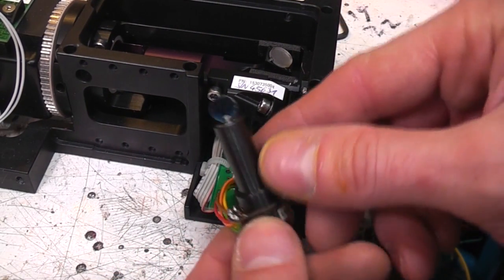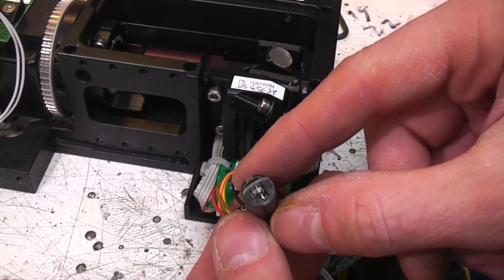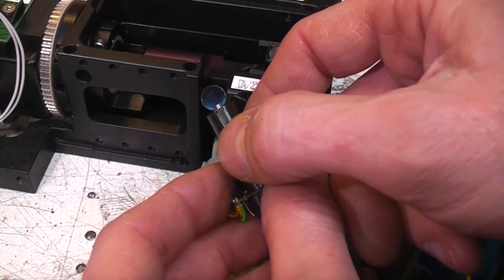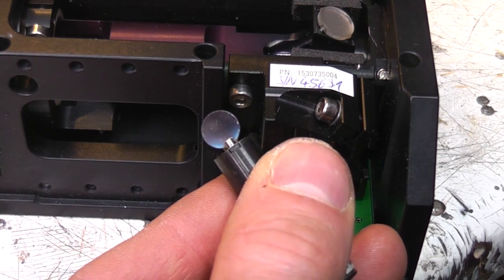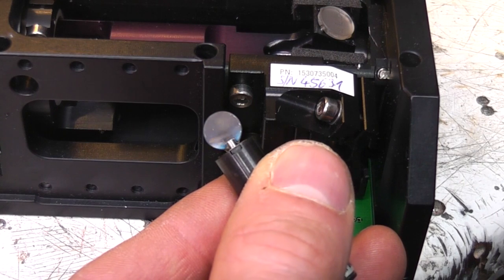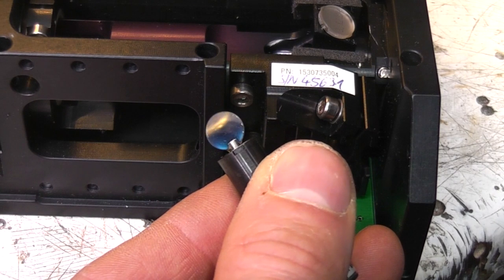Sort of, I think just this back bit is the motor, although it might extend up here, I don't know. You can see a bearing and some end stops and the mirror on the end. And I've just got this running at 10 Hertz. You could probably do some quite fun things with this in combination with a rolling shutter camera to get some bizarre effects. Increasing the frequency is probably going to do some weird strobing things with the camera.